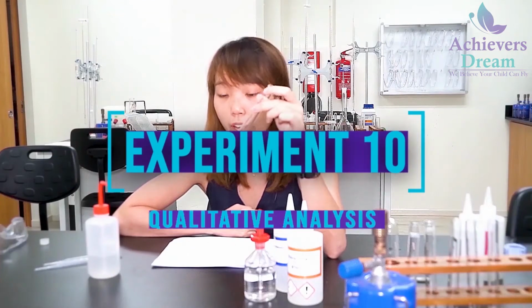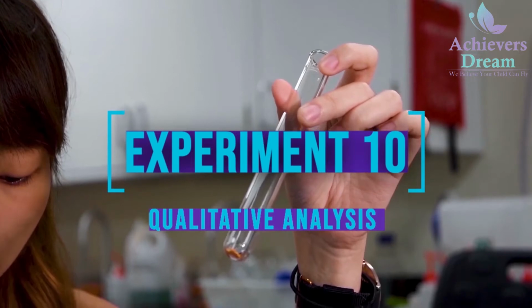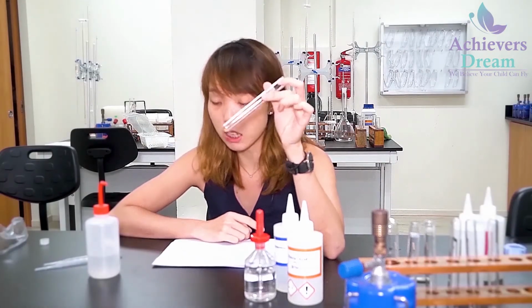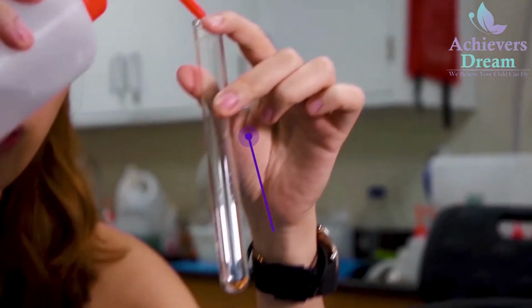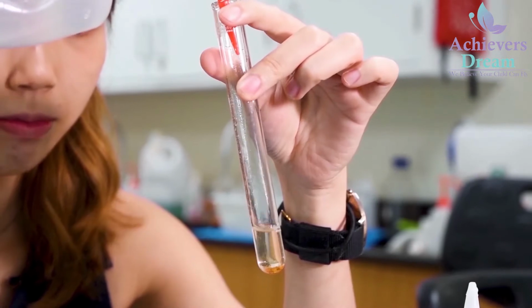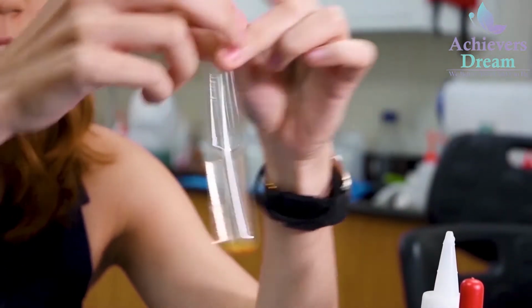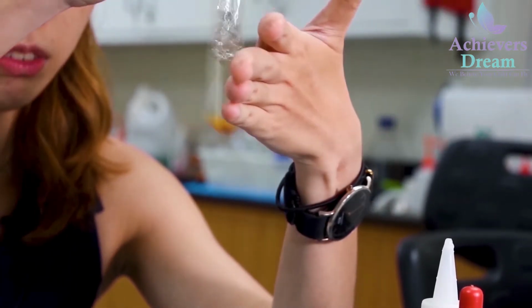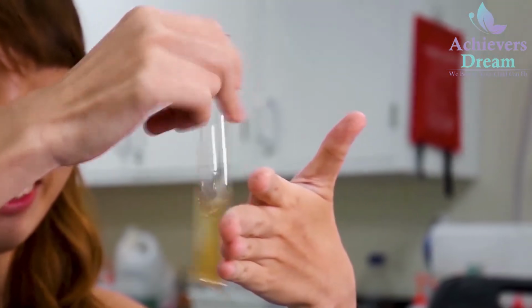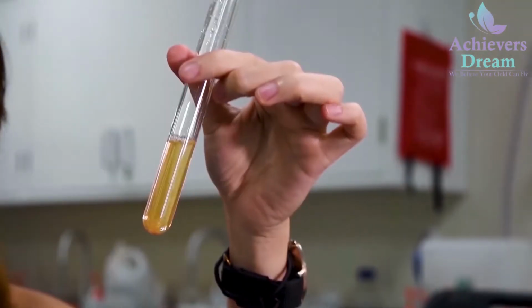Okay, so now for experiment 10, you're provided with solid samples X and Y. So first step is to dissolve a spatula of solid sample X, which is inside this test tube, using DI water. Okay, so this is your solution X.